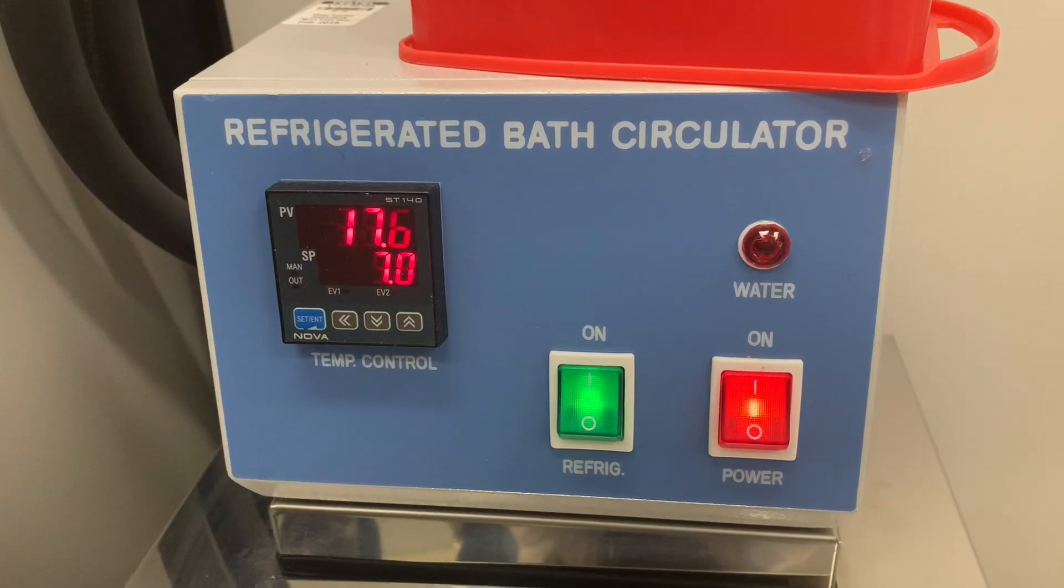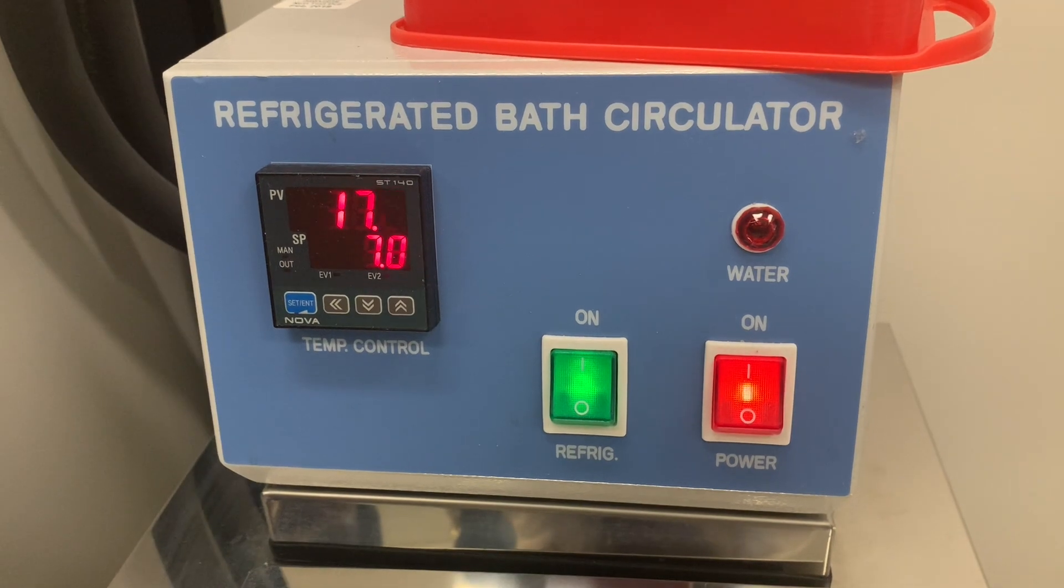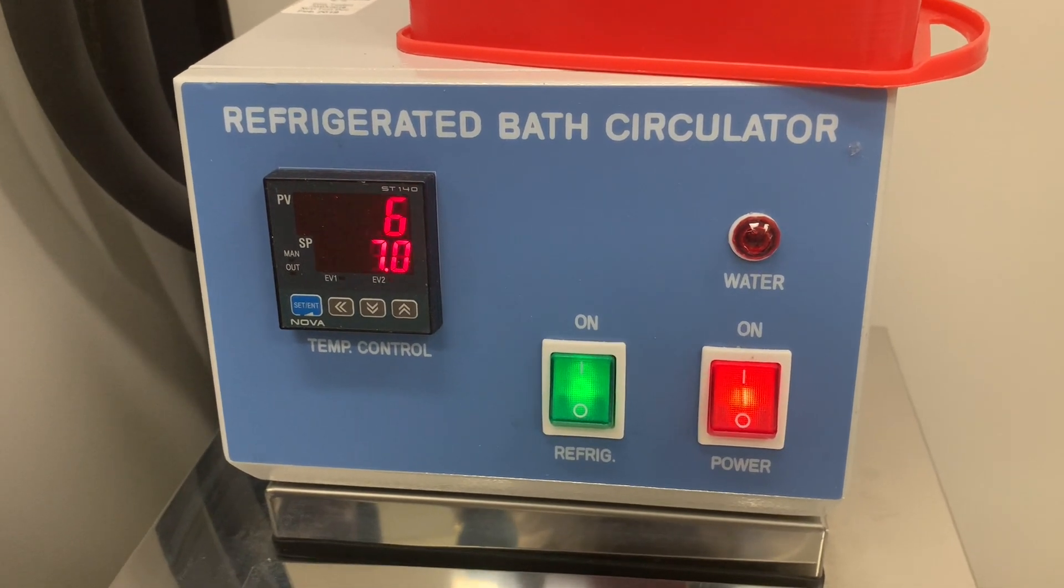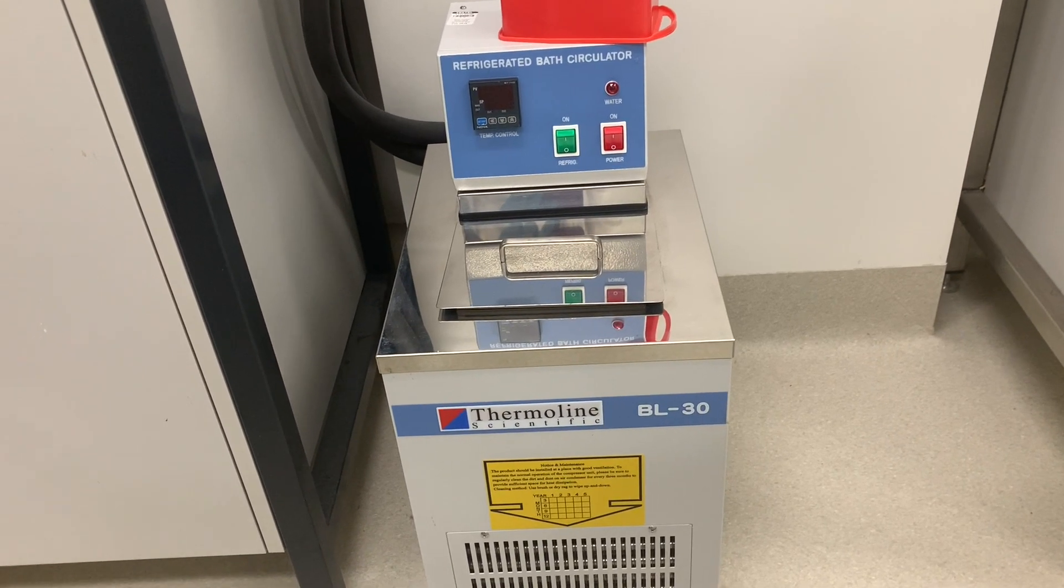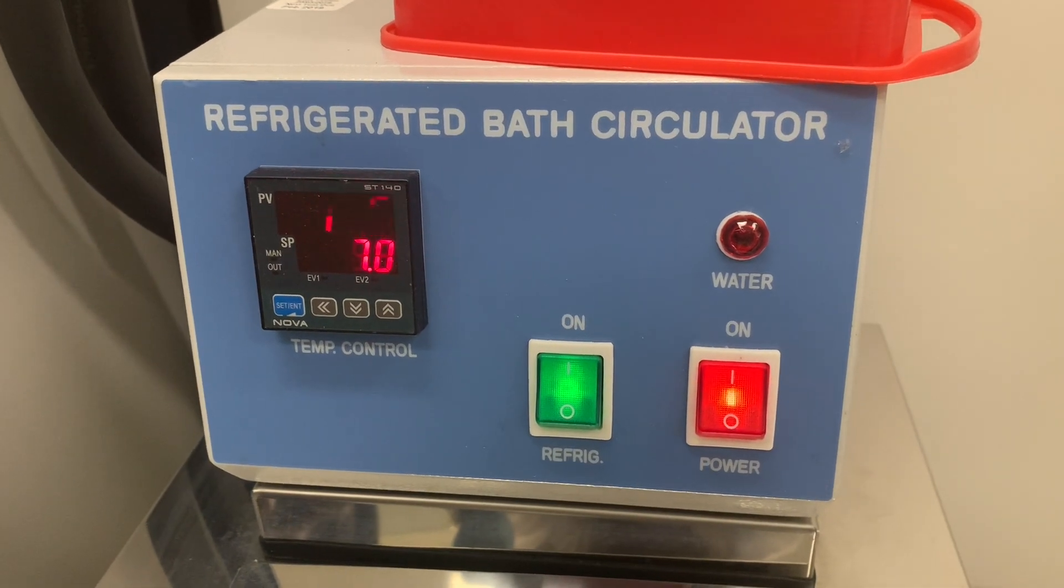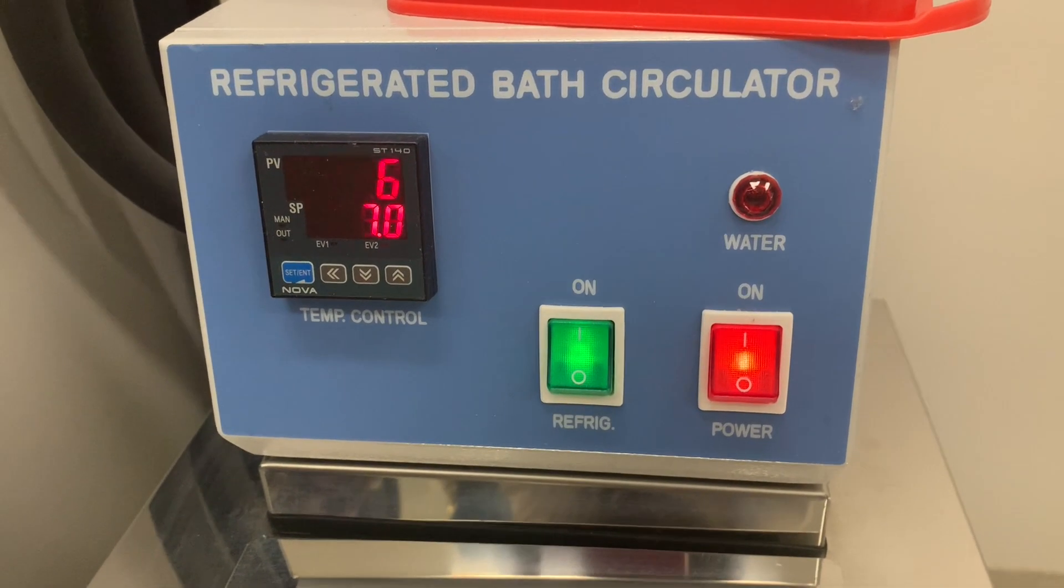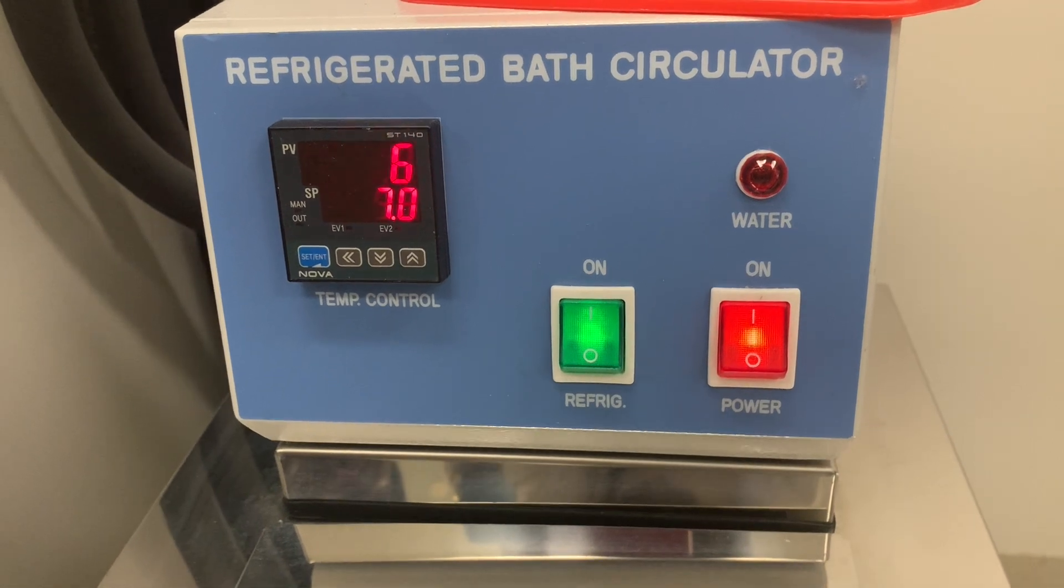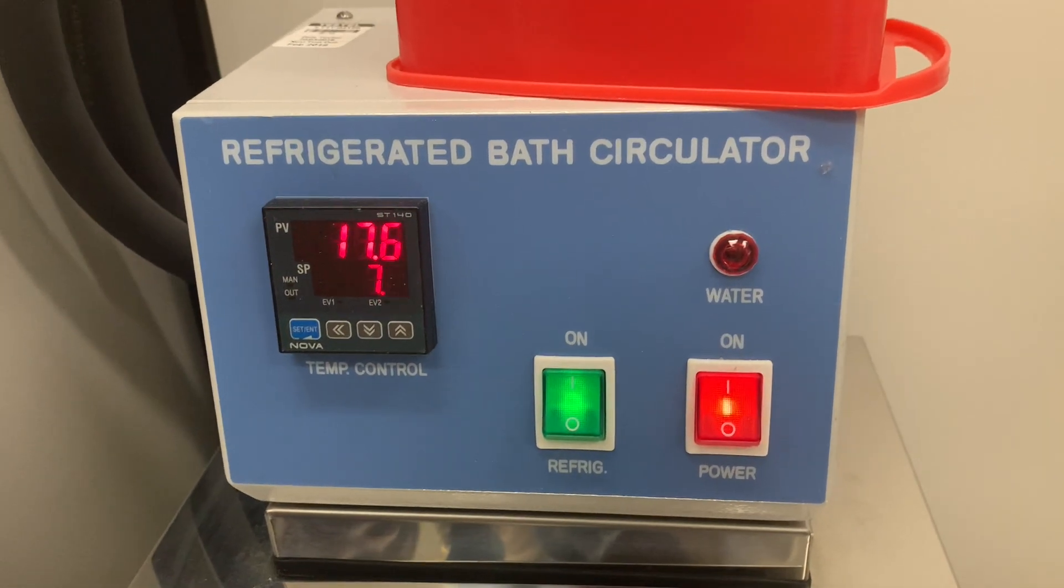If you require refrigeration, depending on how long you are doing the output for, you would have turned on the refrigeration unit and also the system for controlling the power.